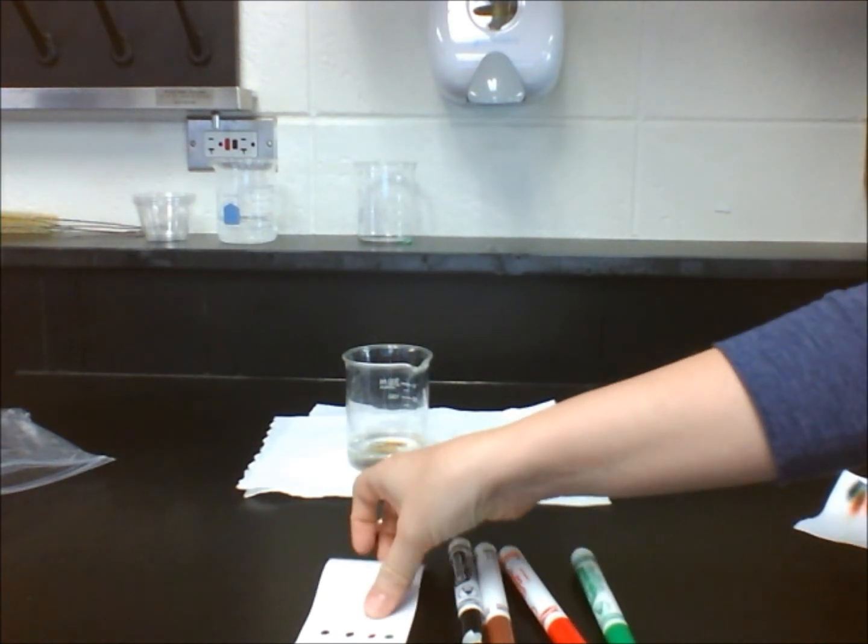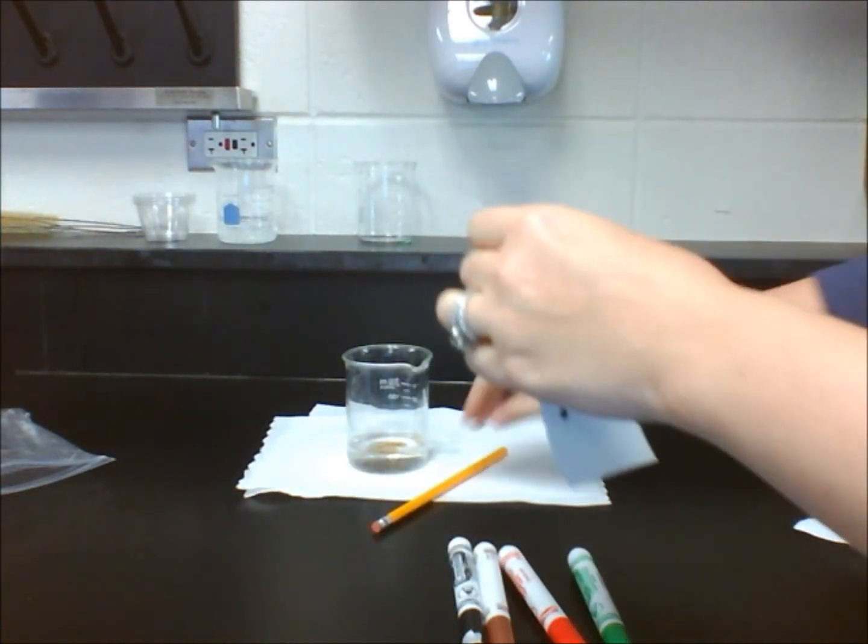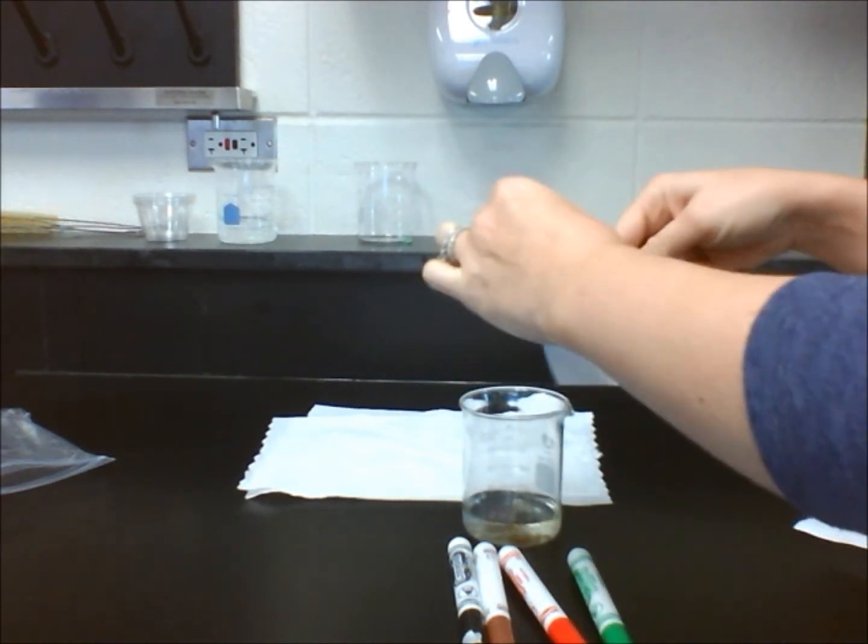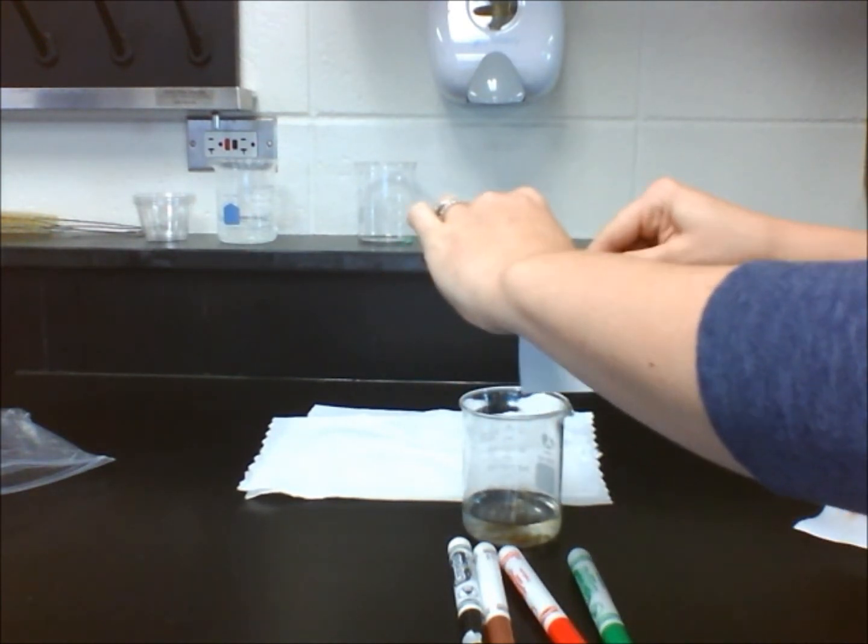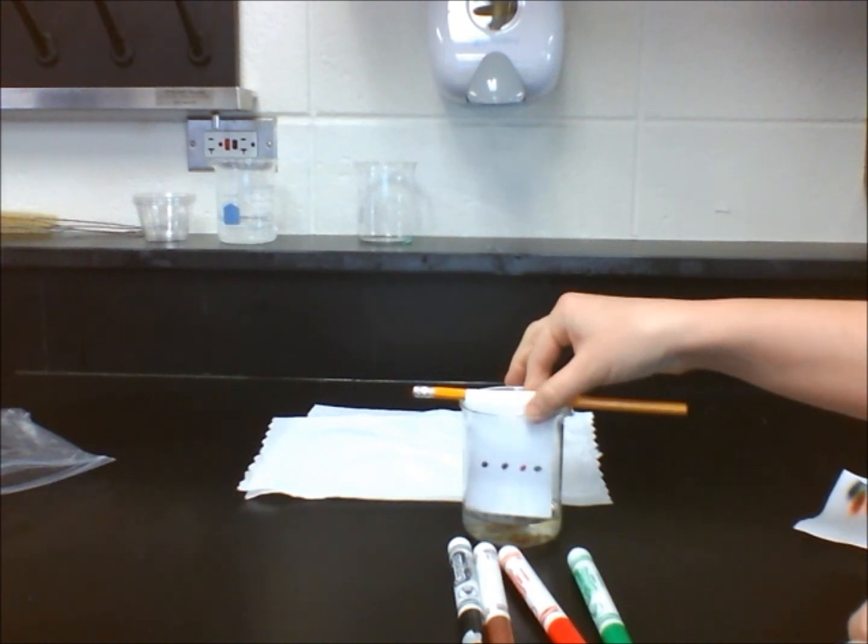Step 3: Fold over the paper about 3 centimeters from the top. Step 4: Rest a pencil across the top of the beaker containing the water and hang the paper on the pencil.